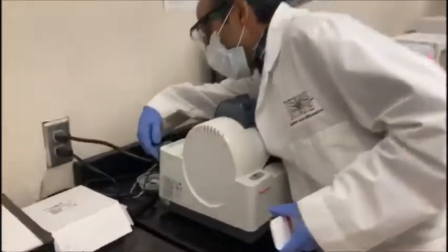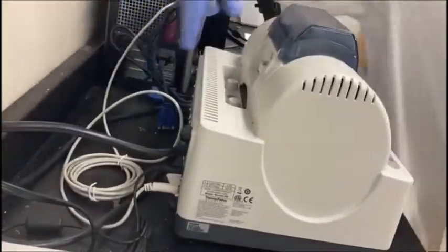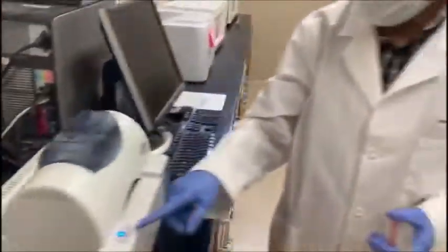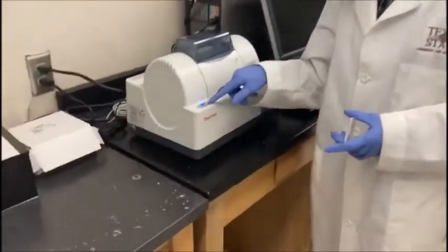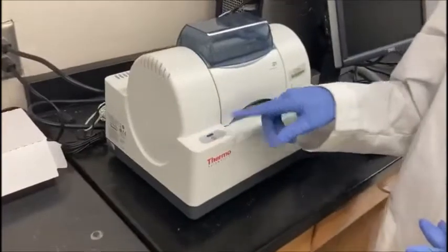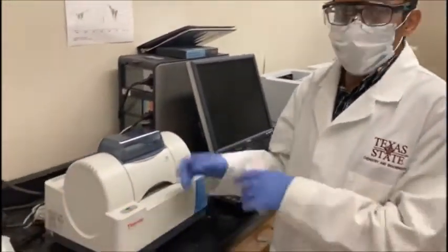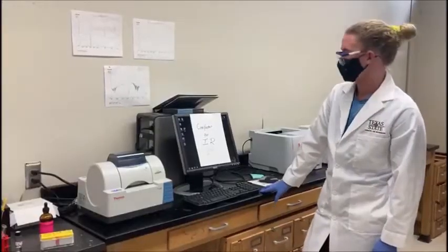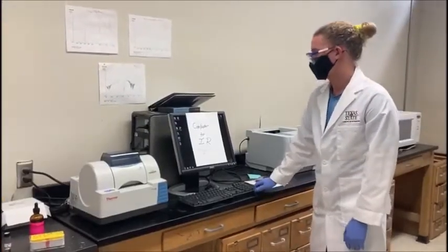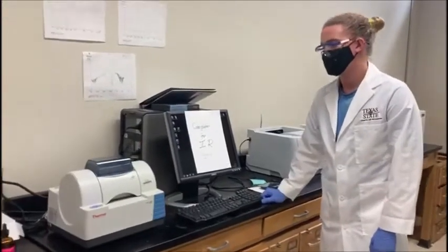This needs to be on, and here you can see this light is on. We will take at least 15 to 20 minutes to warm up, and then we will start it. When you are ready to run your IR after your machine has warmed up for about 15 minutes, you need to log into this computer.